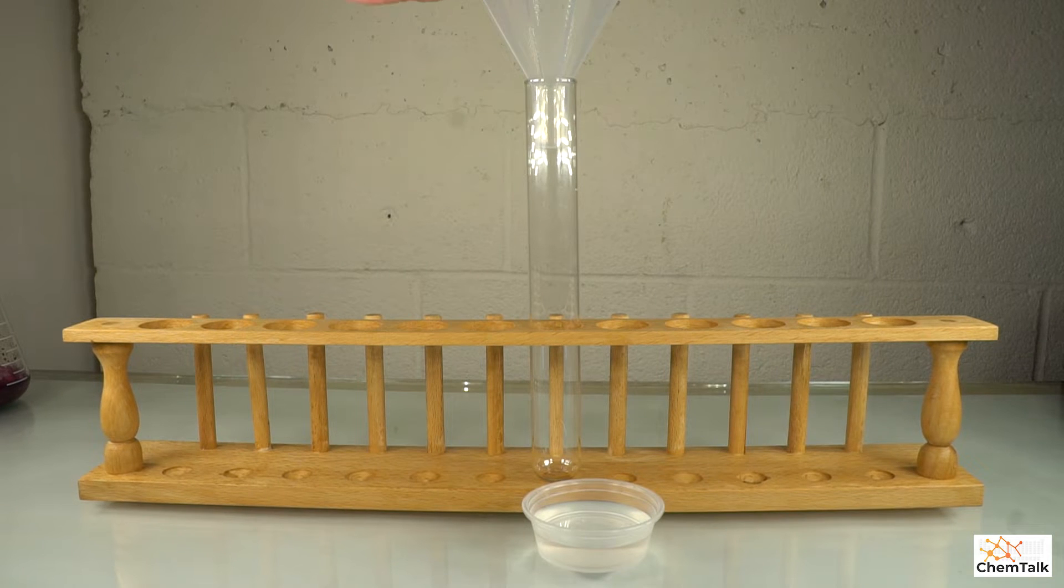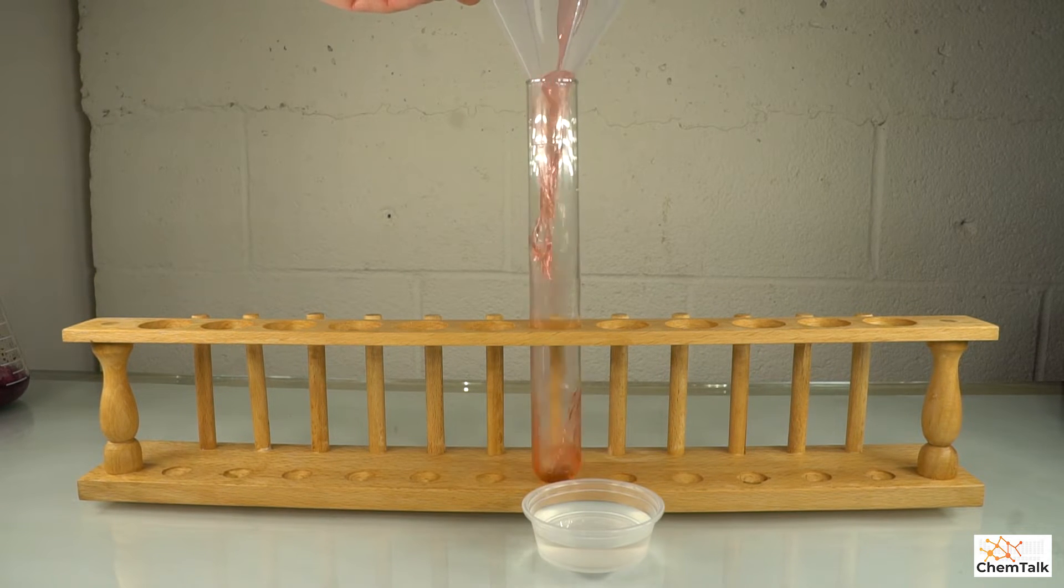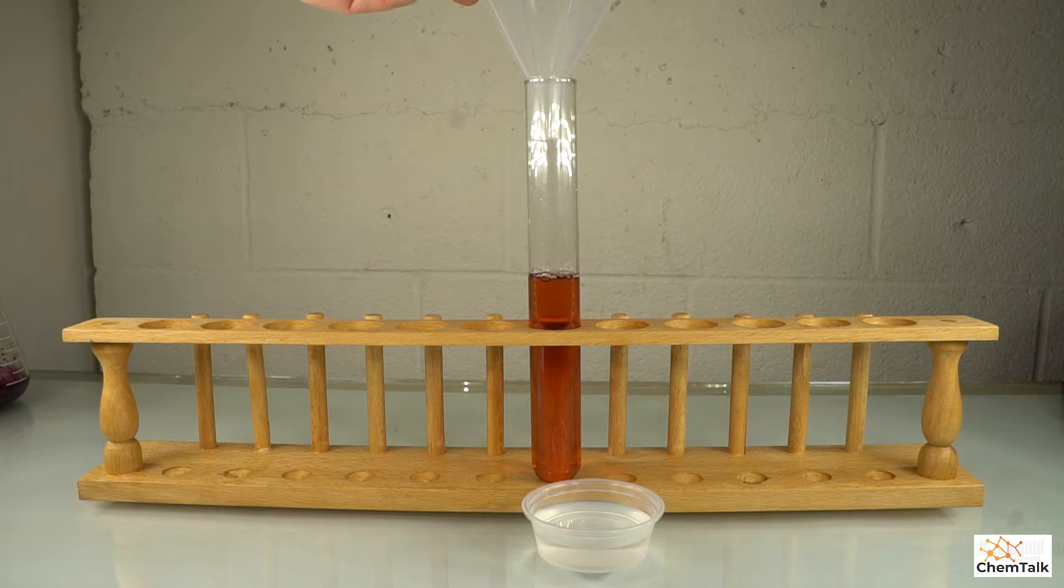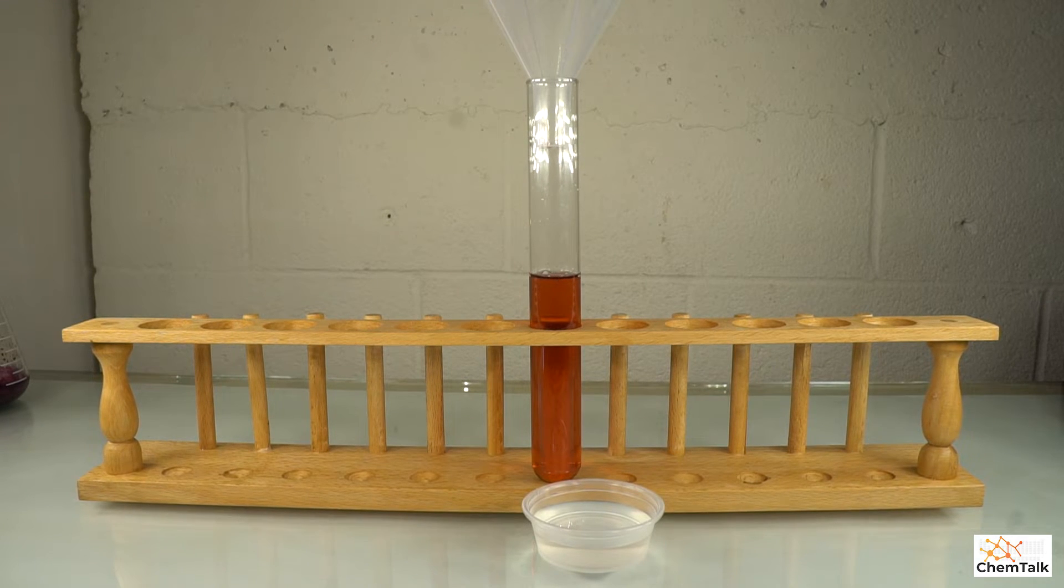So first, we're going to pour this into the test tube. And move that container aside. And you can see that it's a really nice red color.